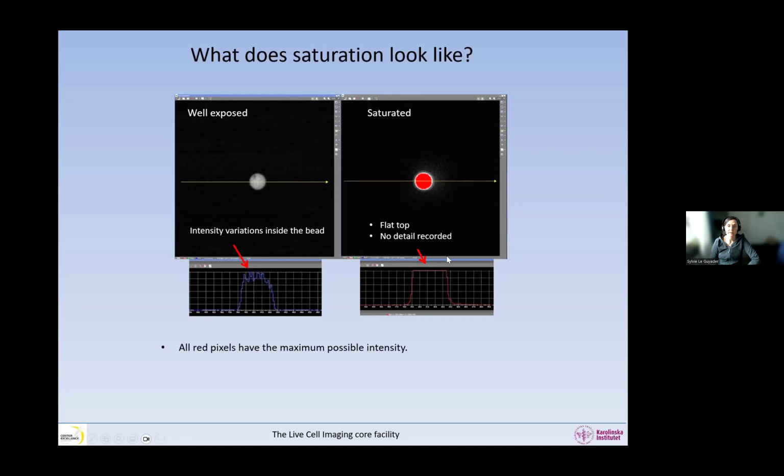And all these pixels here that are color-coded in red have the maximum possible intensity in the image, which is 4095, and we will see why. So the intensity information recorded in these pixels is incorrect. It is not the correct intensity. There are absolutely no details.